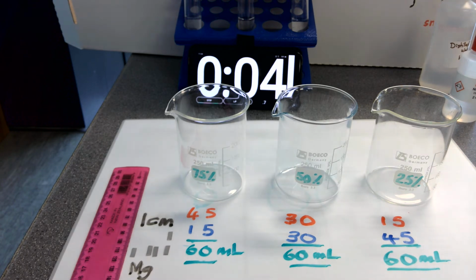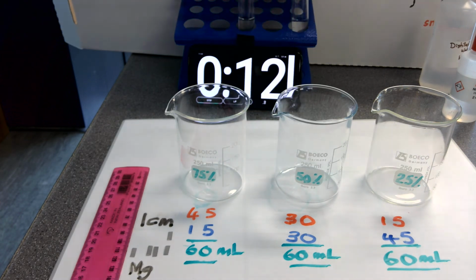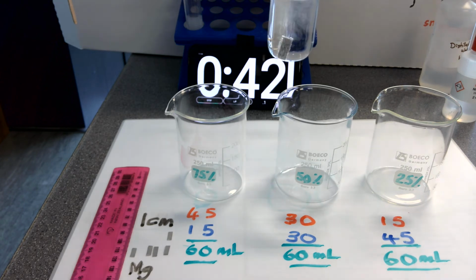Now you may be able to see the reaction of the magnesium metal and the acid there. The bubbles that have been produced in the reaction between an acid and a metal is hydrogen gas, just as a reminder to you. It's coming up in 20 seconds. In 8 more seconds I'll put the acid in there, and note the start time for the second reaction. There you go. And now we're going to wait another 30 seconds before we add the third piece of magnesium to the third test tube.